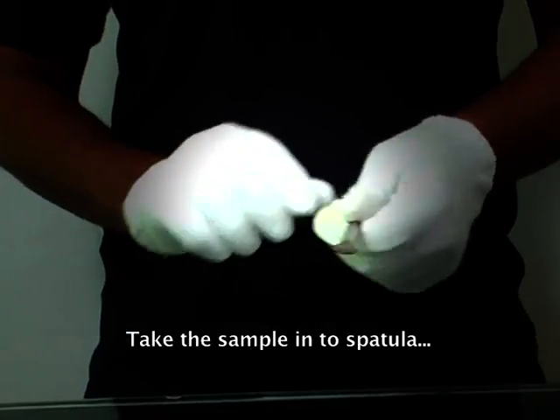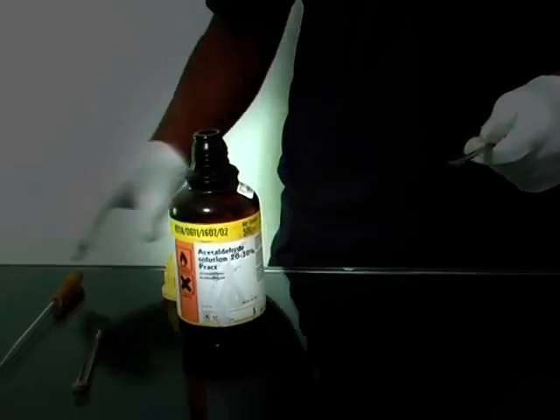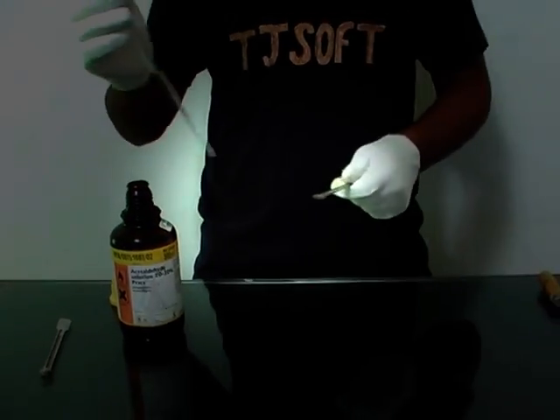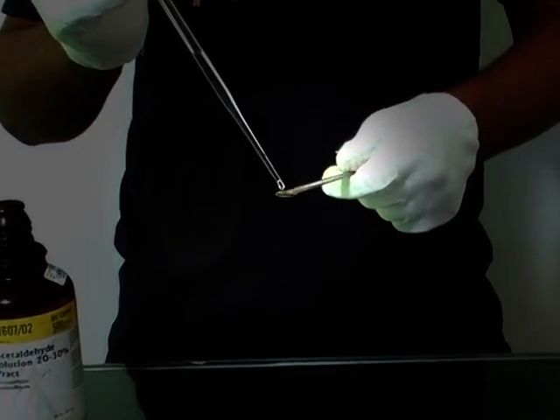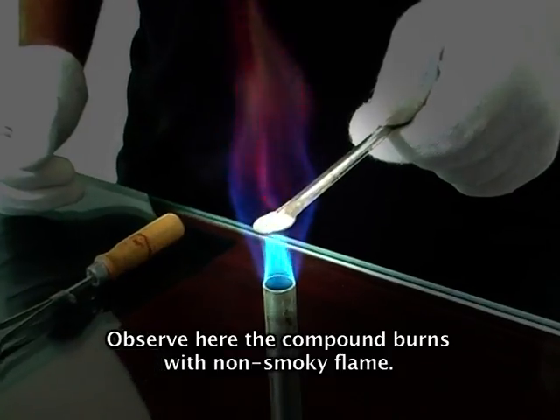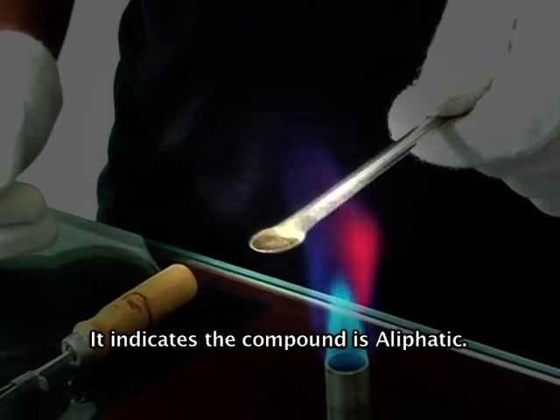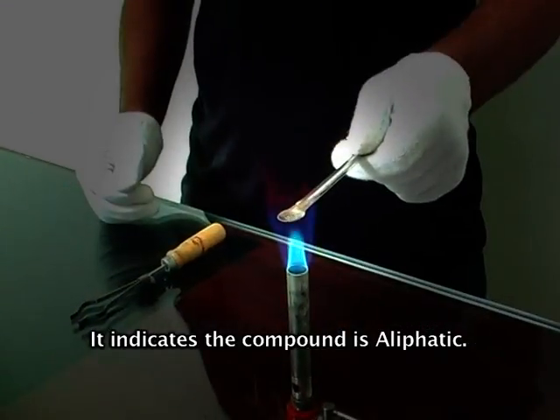Take the sample into a spatula. Observe here the compound burns with a non-smoky flame. It indicates the compound is aliphatic.